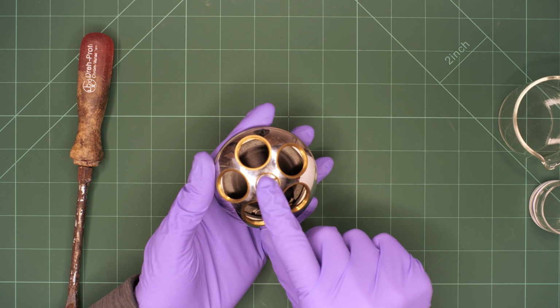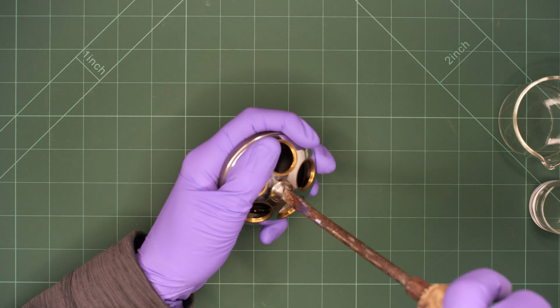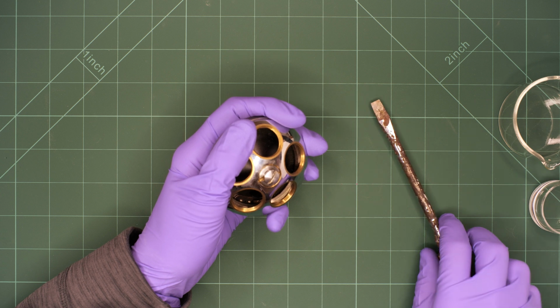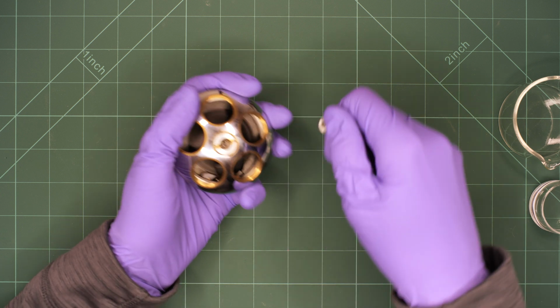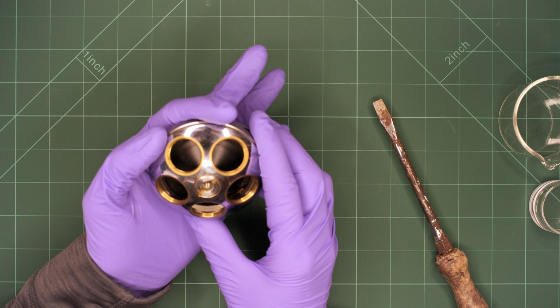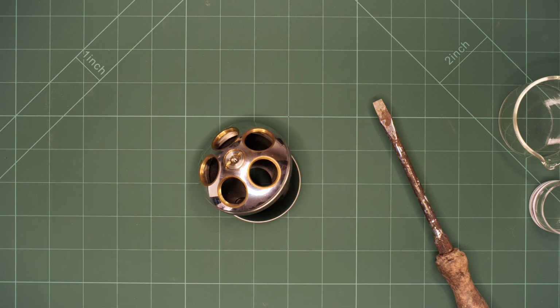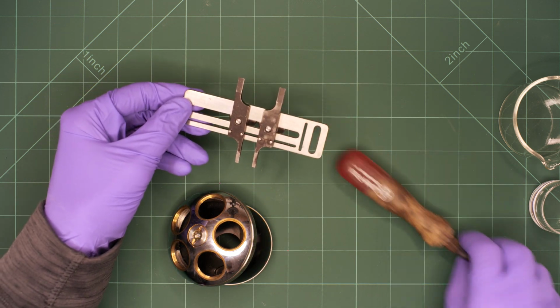We start by removing the first screw. It is important to note that this screw has a left-hand thread. That means in order to remove it, we have to unscrew it clockwise. After its removal, we are greeted with a special nut that either requires a very wide flathead screwdriver or a special tool which is most commonly used for camera lens maintenance. I have a custom tool for that, but I will link several options in the video description, including the one I am using.